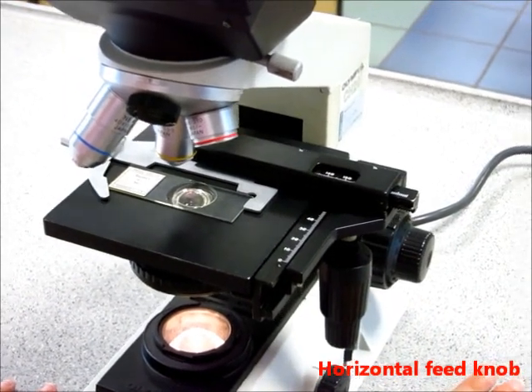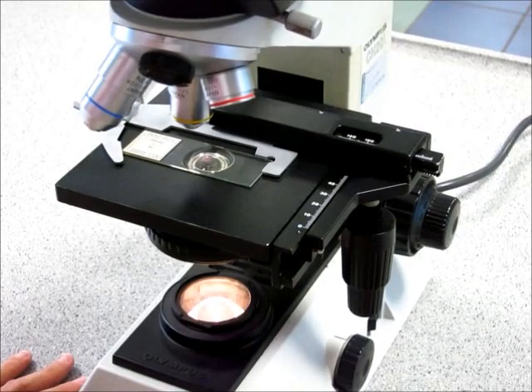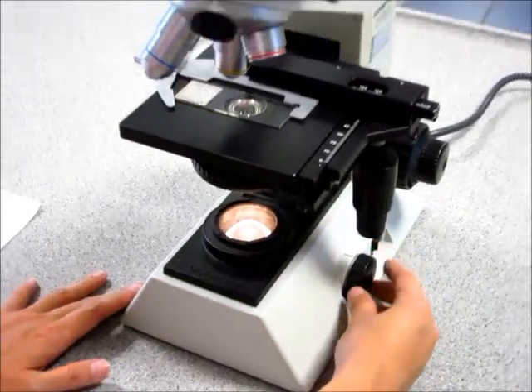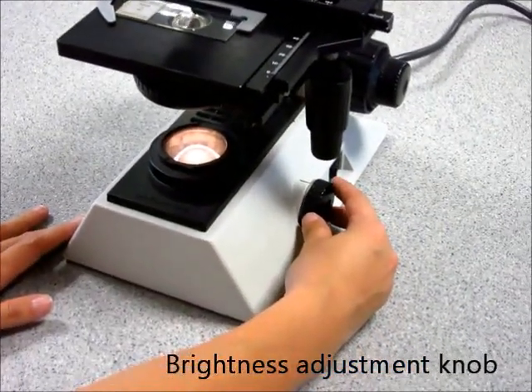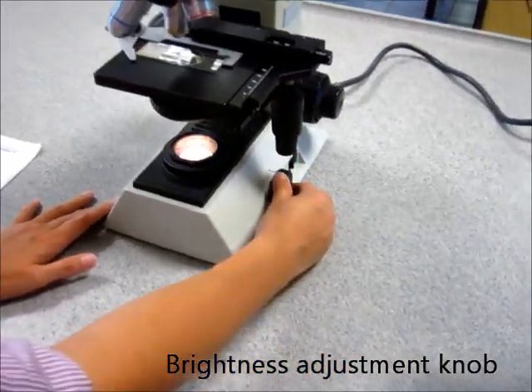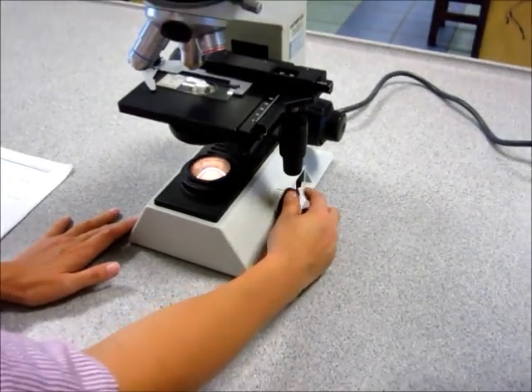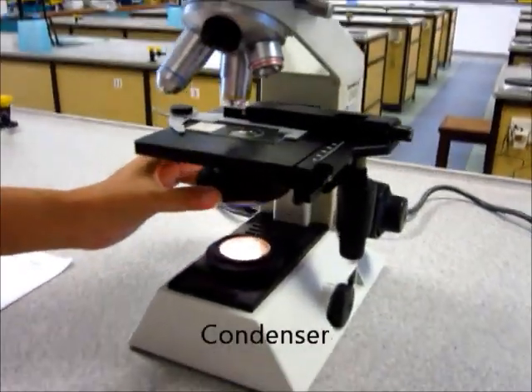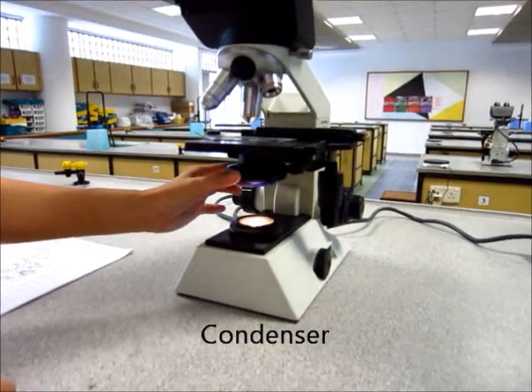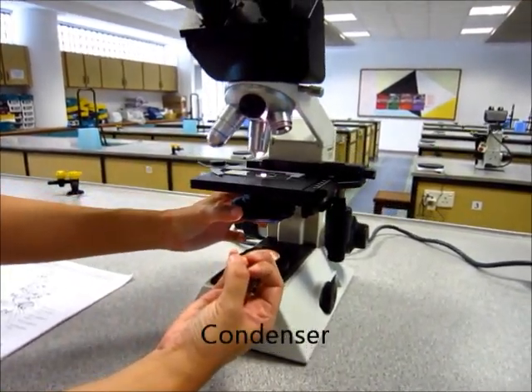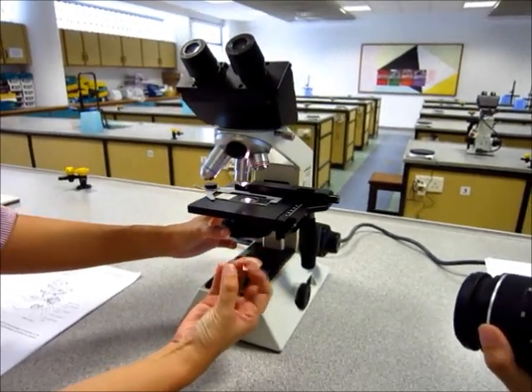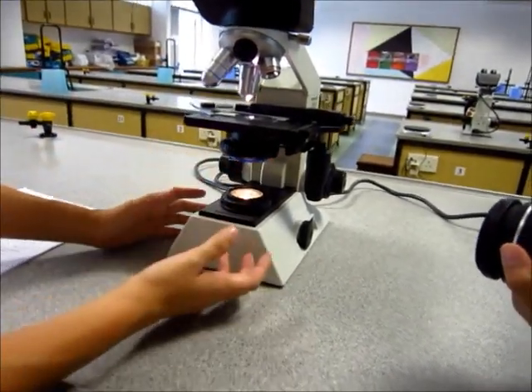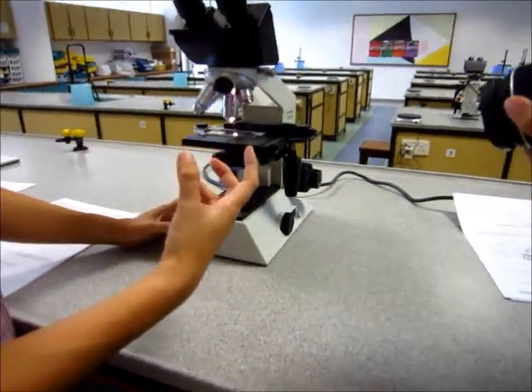Lastly, sometimes you need to adjust the brightness of the light. We can do this using two different methods. One is to adjust what we call the brightness adjustment knob over here. If you turn it, the light will grow dimmer or brighter as you like. There is also a condenser aperture here that is just below the stage. You turn it and this basically causes the opening to open and close accordingly. So we use this to make the images a bit brighter or a bit dimmer.